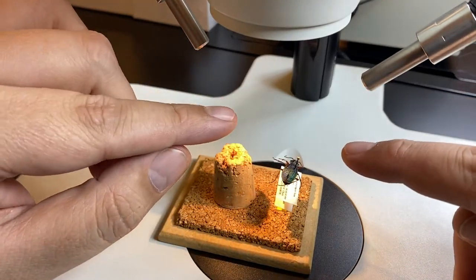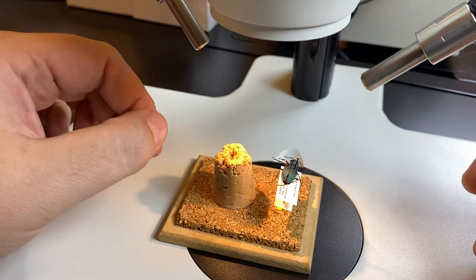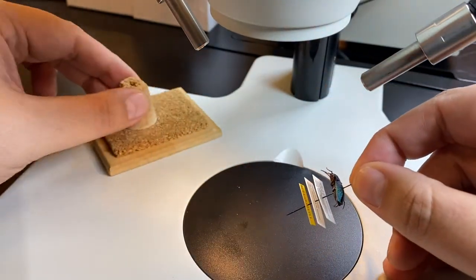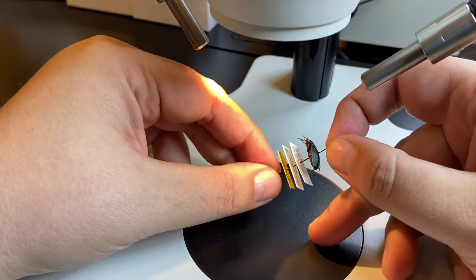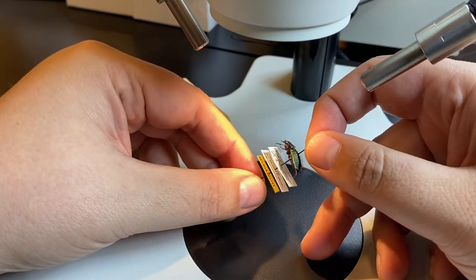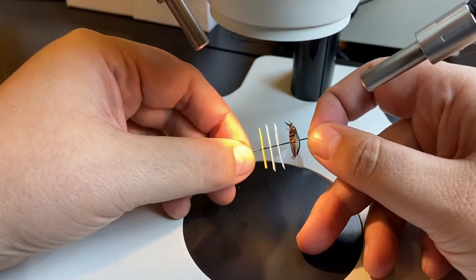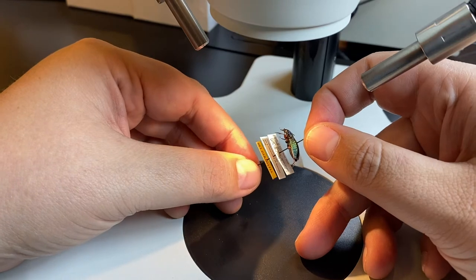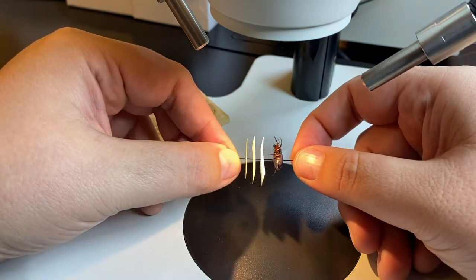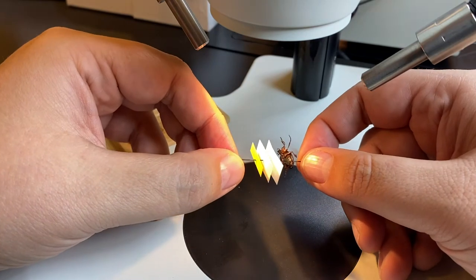What I do with a pinned insect is set my focal plane for the microscope a little bit above the top of the pinned beetle, because I usually don't leave it on something underneath — I'm actually holding it in my hand. I'm almost always holding the specimen in both hands between my thumb and forefinger, with my hands anchored against the bottom of the table. I can look through both eyes and rotate and spin the specimen to the exact angle I want, allowing me to see characters from different angles and get the lighting just right.